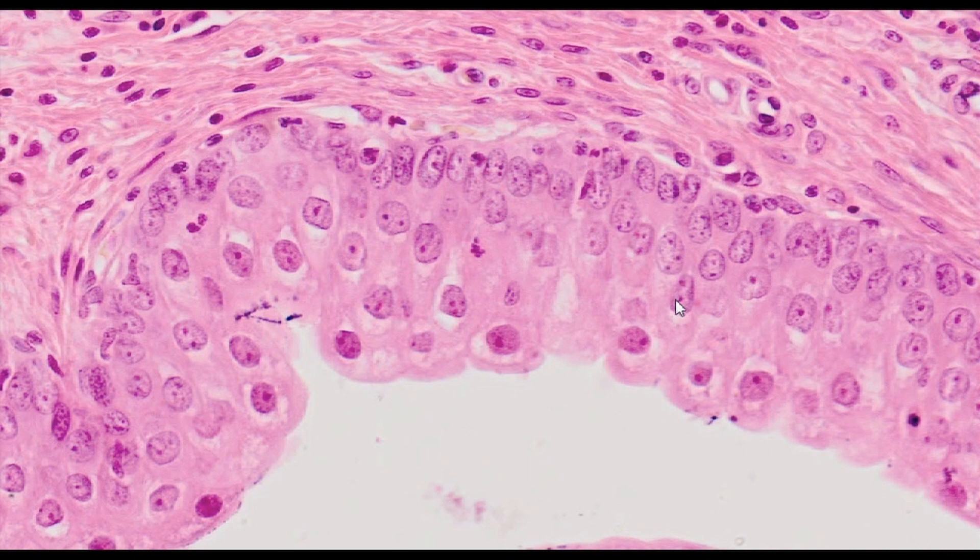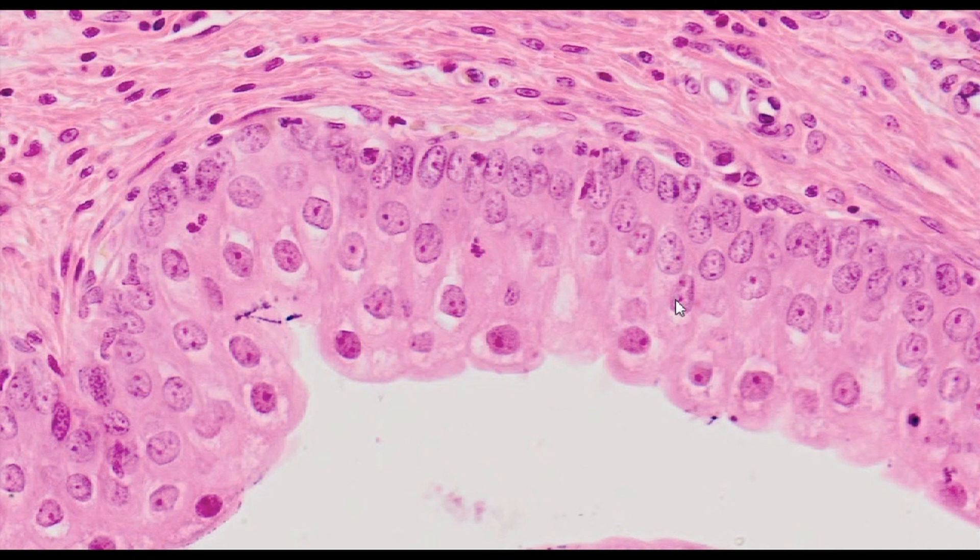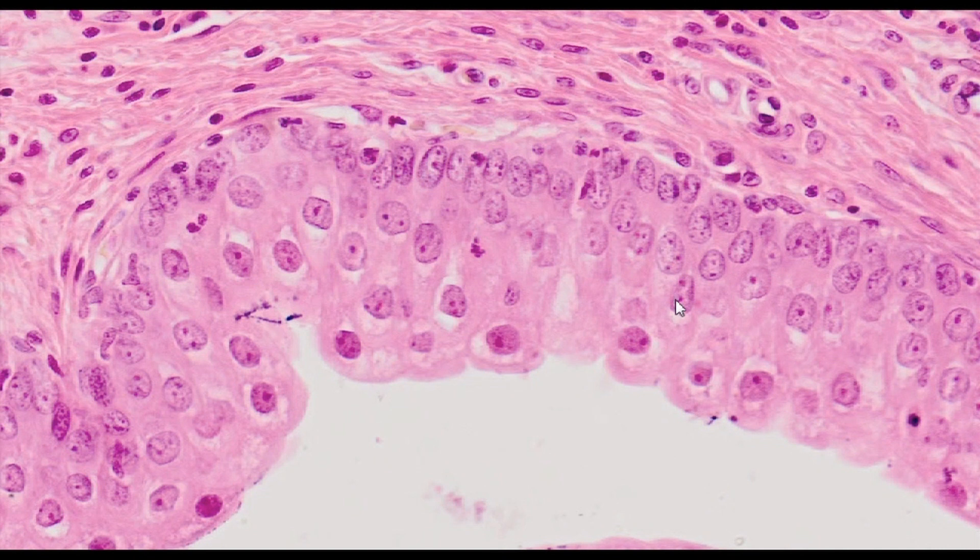The name of this epithelium is associated with changes in its structure and appearance, reflecting the degree of bladder filling.